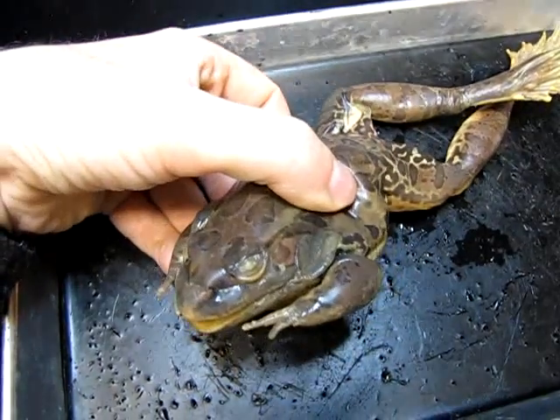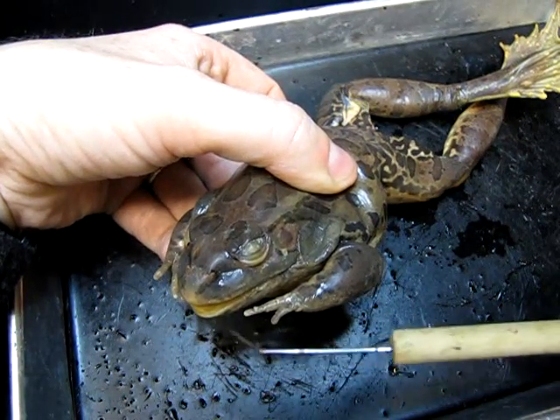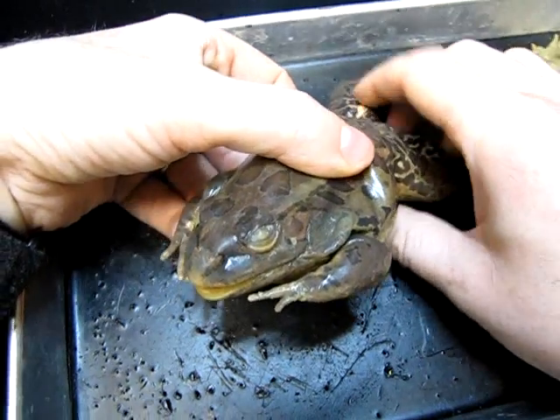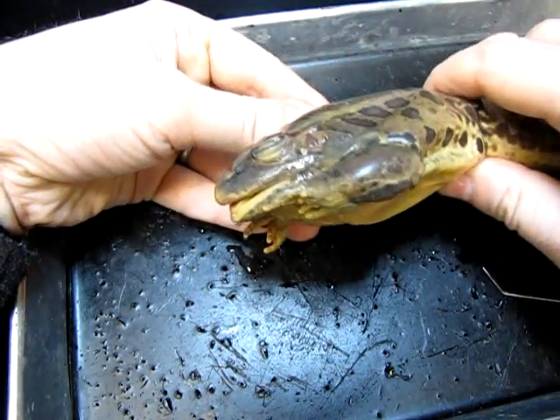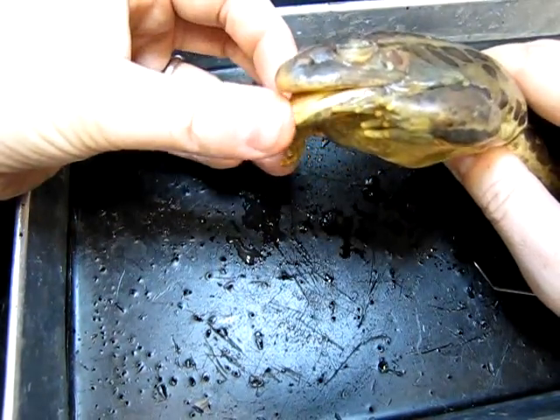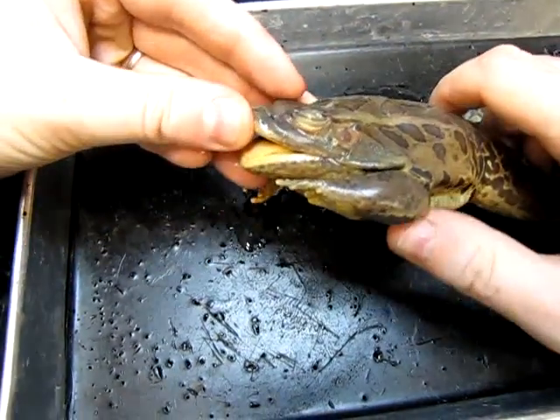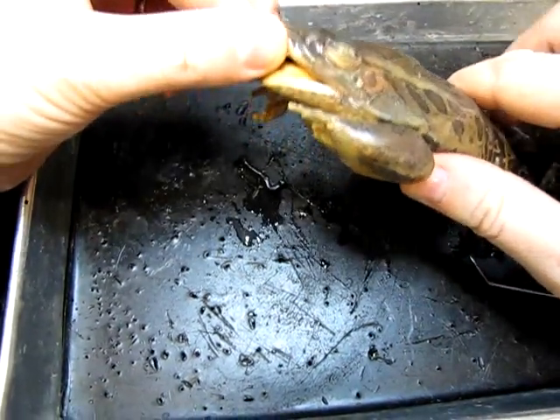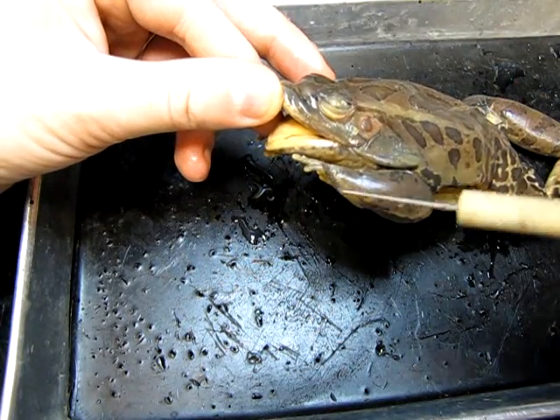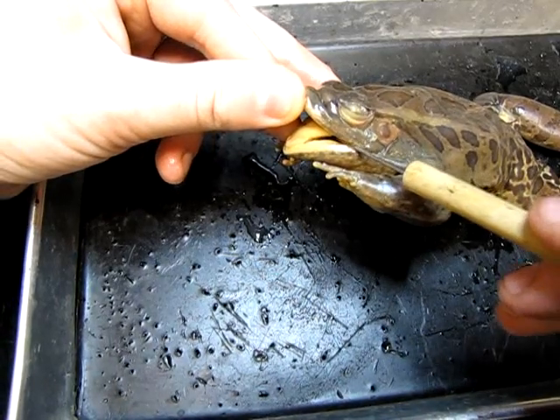I just wanted to point out a couple of interesting features of the mouth. Frogs are carnivorous animals, so they are adapted to capture and consume other organisms. They can eat everything from insects to other vertebrates, including small mammals, reptiles, other amphibians, and other frogs. One interesting adaptation is that frogs use their tongue with a sticky secretion to catch their prey in many cases.